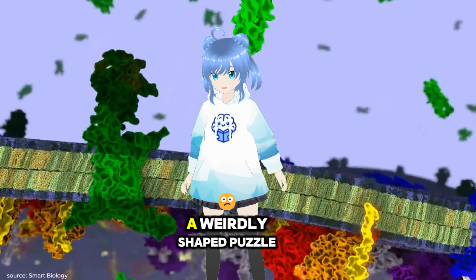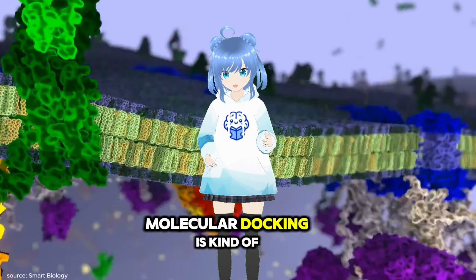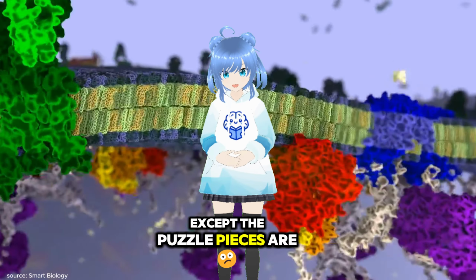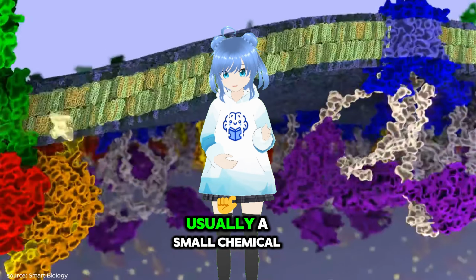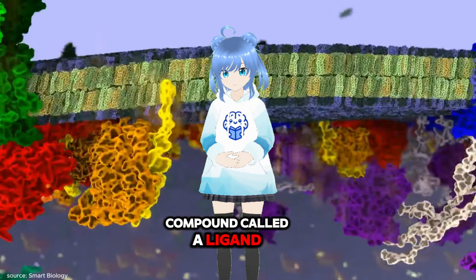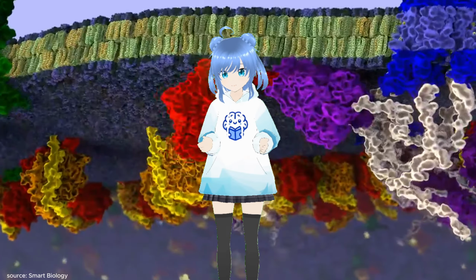Imagine you're trying to fit a weirdly shaped puzzle piece into its spot. Molecular docking is kind of like that, except the puzzle pieces are tiny molecules. The goal is to see how one molecule, usually a small chemical compound called a ligand, fits into another molecule, typically a protein that serves as a receptor.